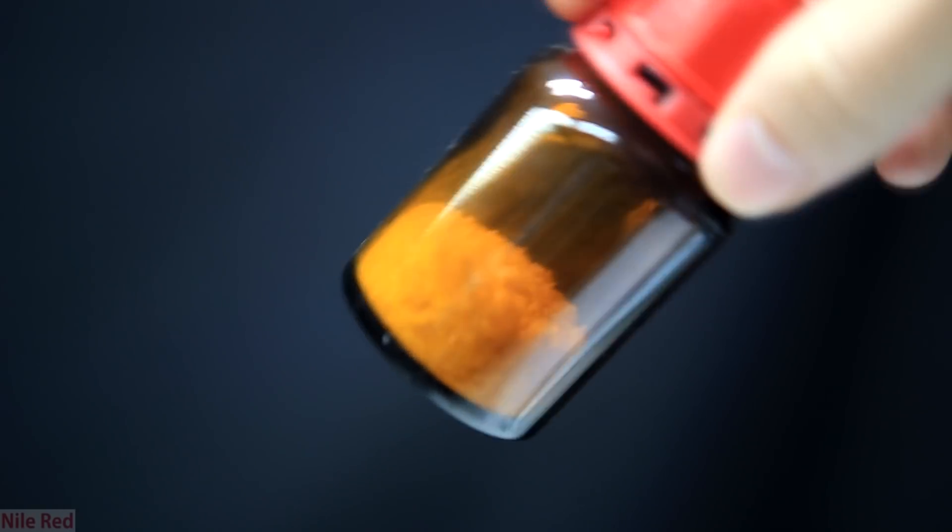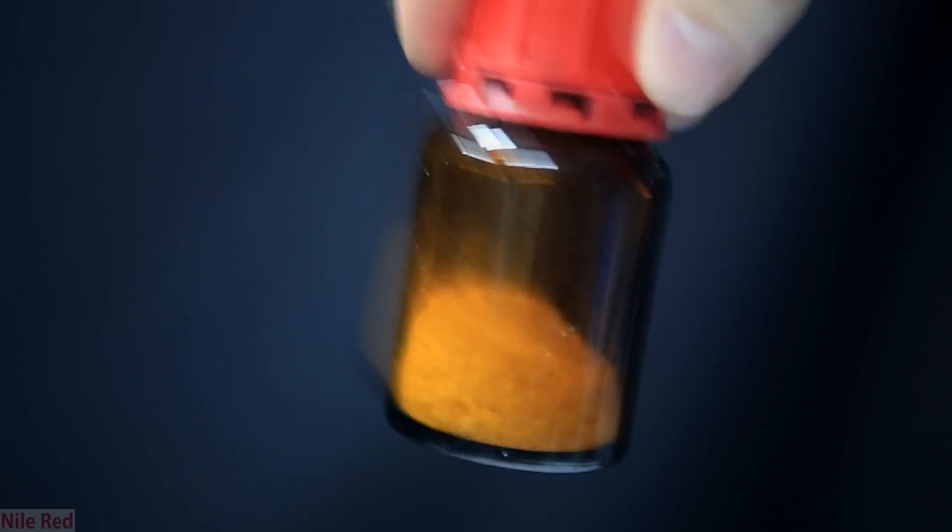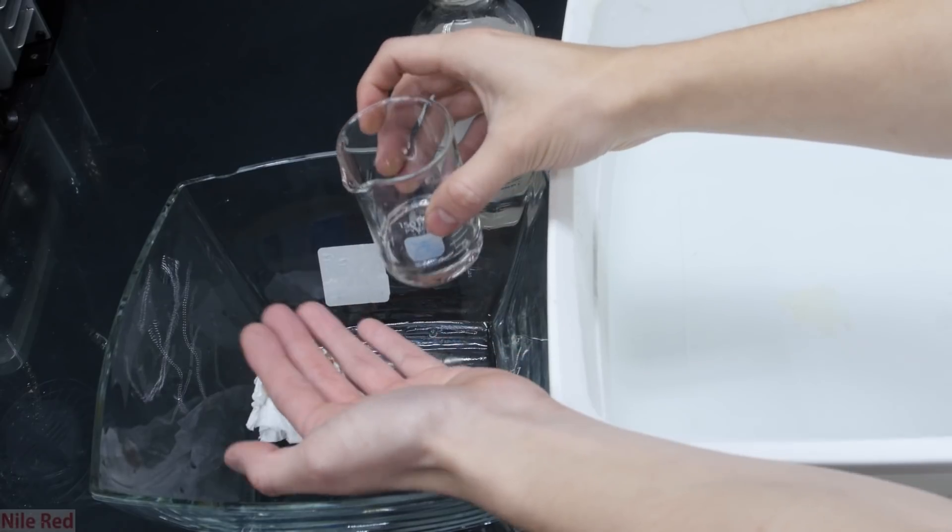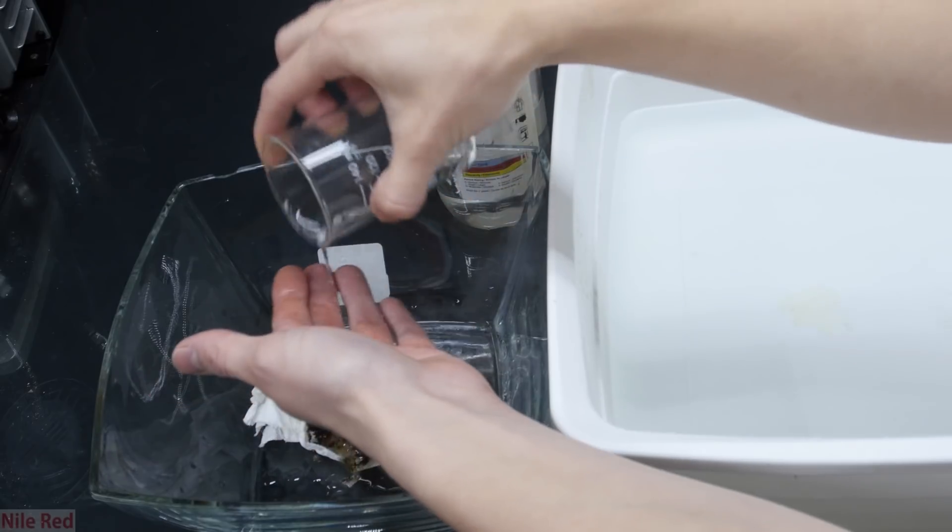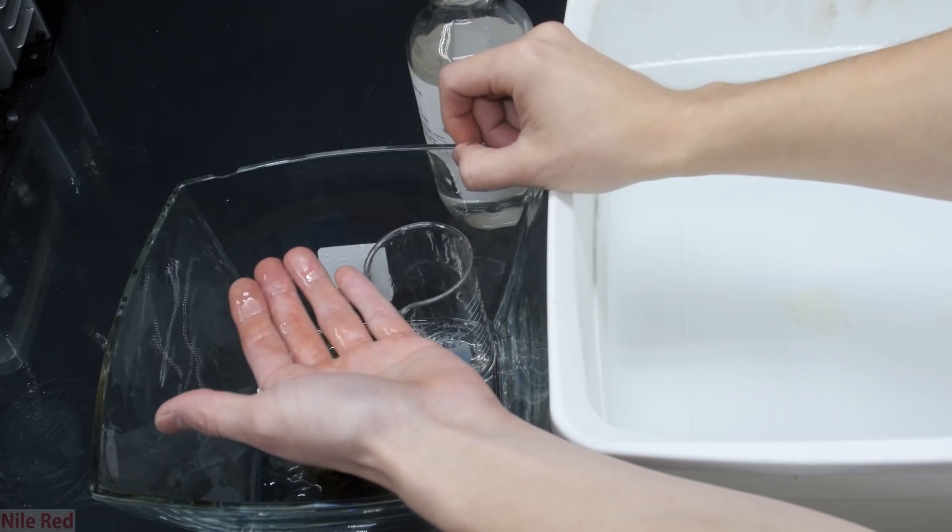Like I said I do plan to use this and make vanillyl amine out of it but up until now I haven't had any luck. As a bonus I'll leave you with a short clip of me pouring concentrated sulfuric acid onto my hand. Don't worry my hand is perfectly fine and I'll post a video in the future explaining exactly why I did this.